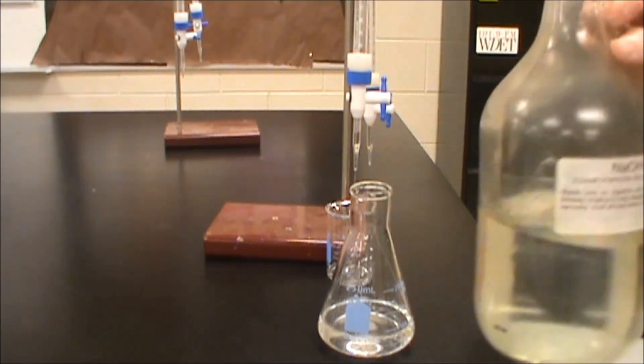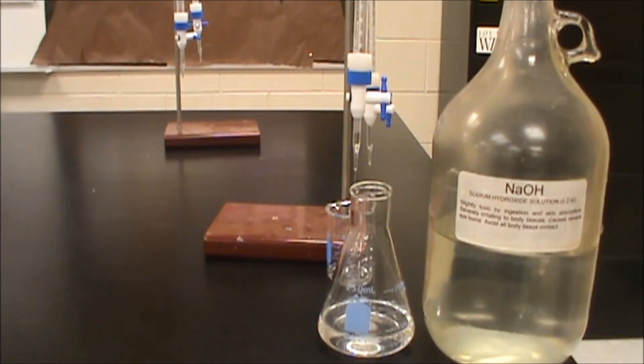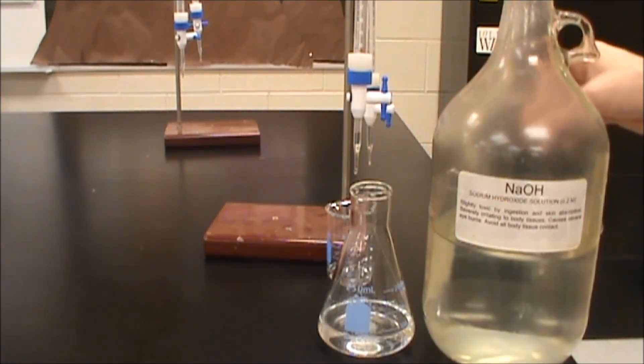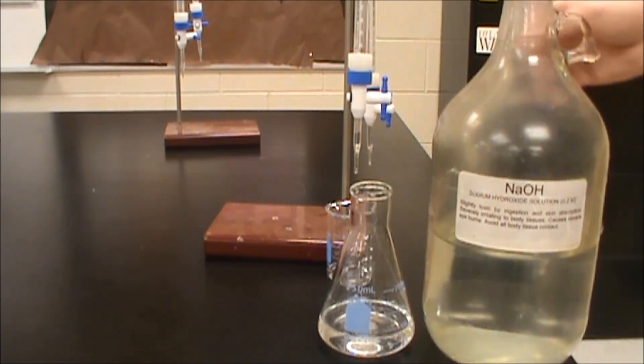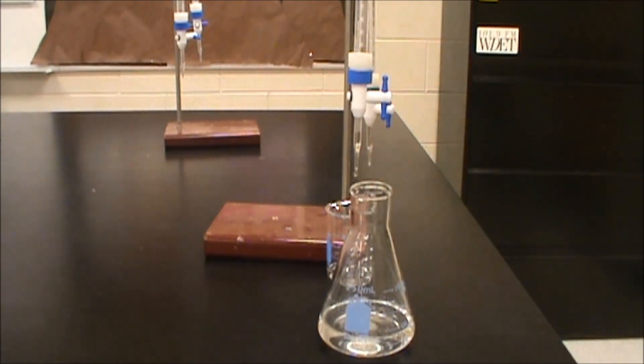So sodium hydroxide the reason why we're doing this is because sodium hydroxide will absorb a lot of water as well as carbon dioxide from the air will react with the water itself and that'll make sodium carbonate or sodium bicarbonate. So really what we're trying to do here is we're trying to get through and see what this actual concentration is. It should be about 0.2 but we don't know exactly what it is.